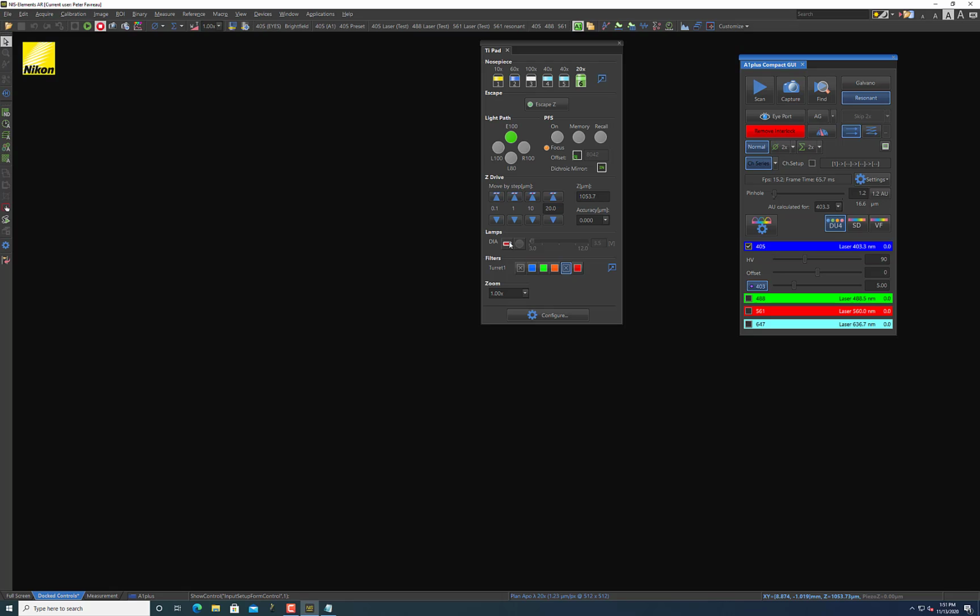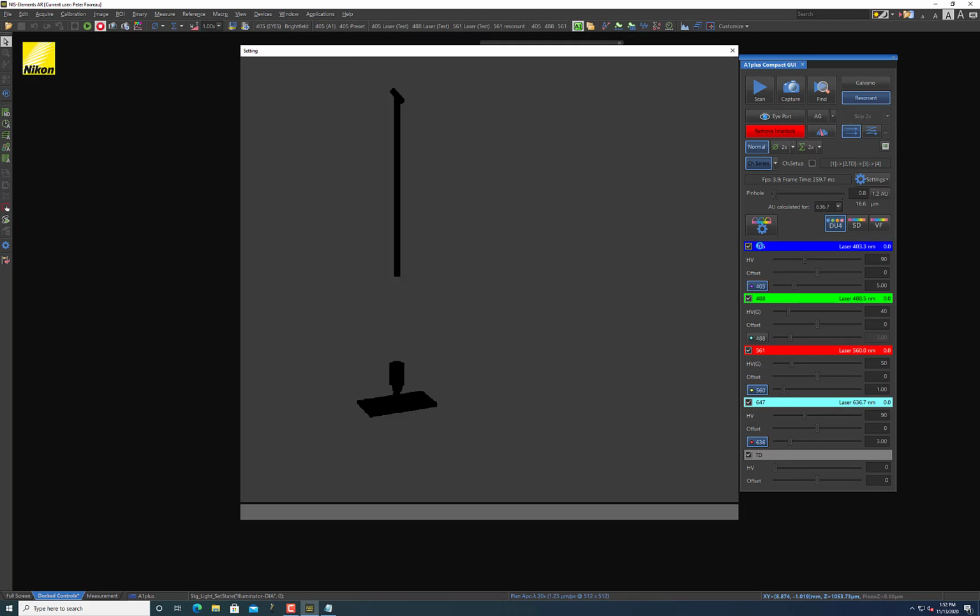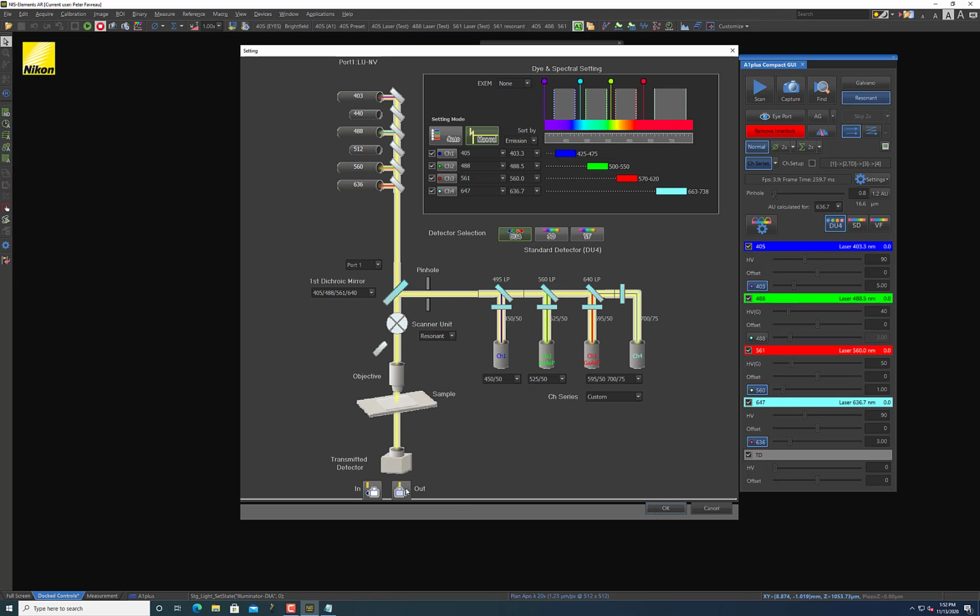So by doing this, you'll see, hopefully on the stage when you turn it on, that there is no light present on the stage. Even though this says it's on, the Brightfield lamp will not turn on. And that's because the software, and indeed the microscope itself, has a built-in mechanism where it will not allow you to turn on the lamp when the transmitted detector is on, presumably to save the transmitted detector from being overwhelmed with photons. So in order to use the Brightfield lamp, you cannot have the transmitted detector in alignment in your optical pathway. So to make it work, you'll have to press out here.